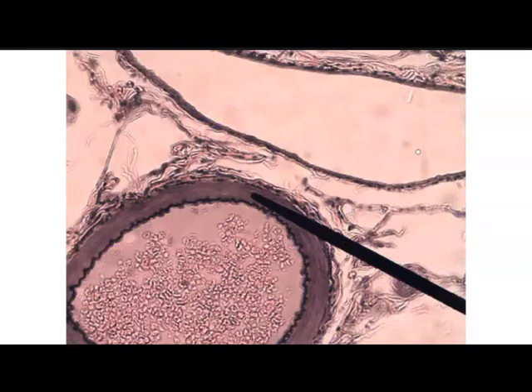This slide shows you the differences between an artery and a vein. So again, a vein has a thinner layer of cells within its walls, whereas within the artery we see that thick muscular tunica media, and it's a lot thicker compared to the tunica media of a vein. So this structure below the pointer would be an artery, whereas this structure here above the pointer would be a vein.